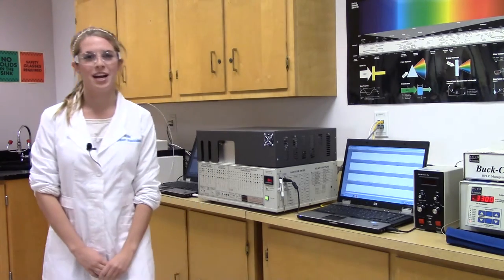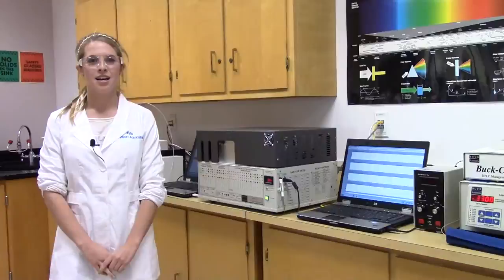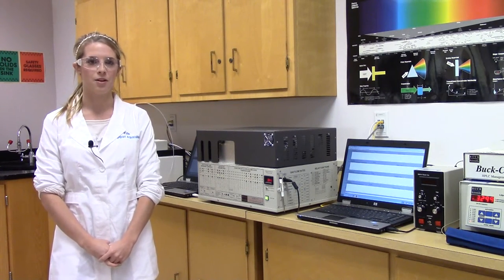Today, I'm going to instruct you on how to use a Buck Scientific GC, or gas chromatograph. We are going to be running a dilution of mouthwash through the GC to test how much alcohol there is.